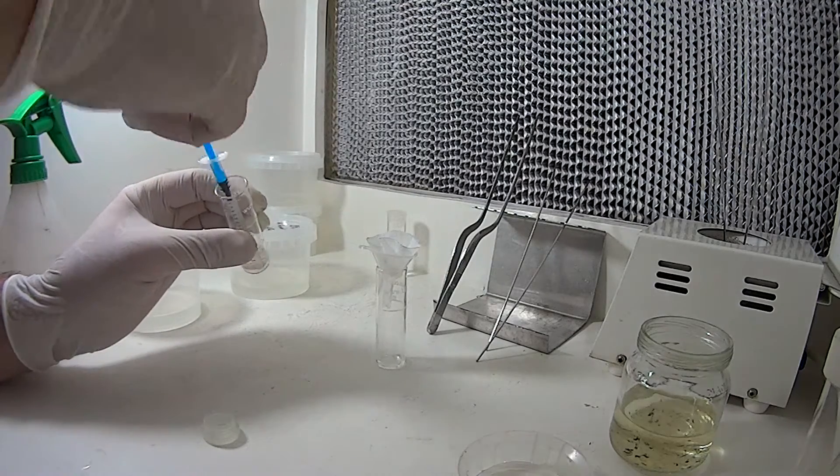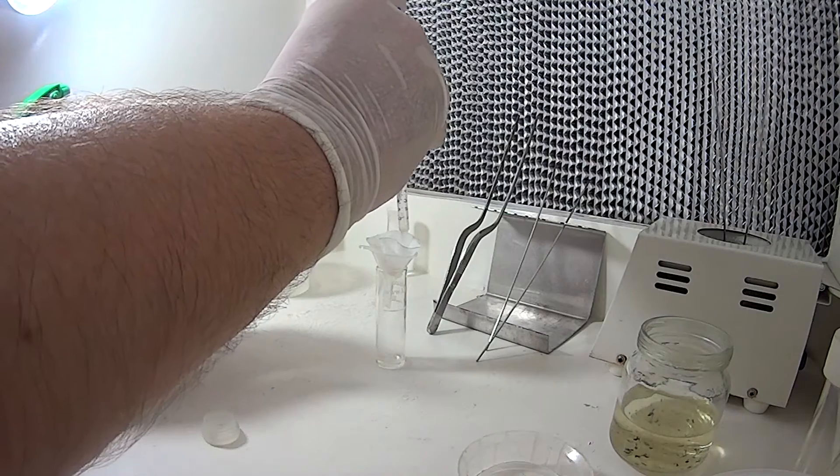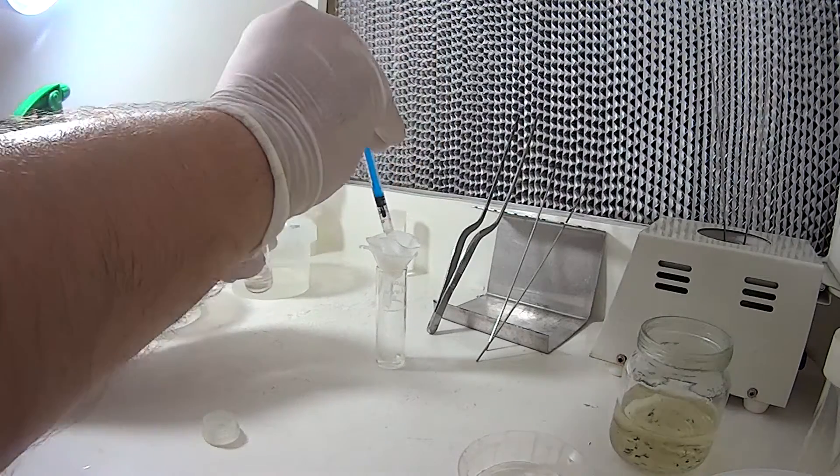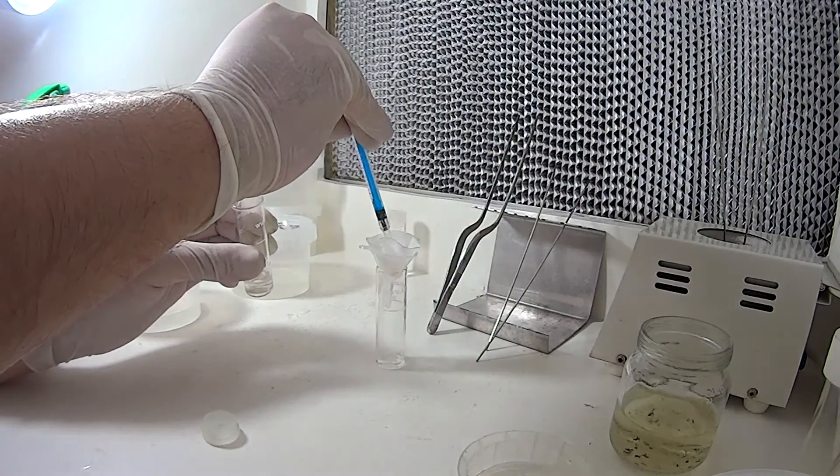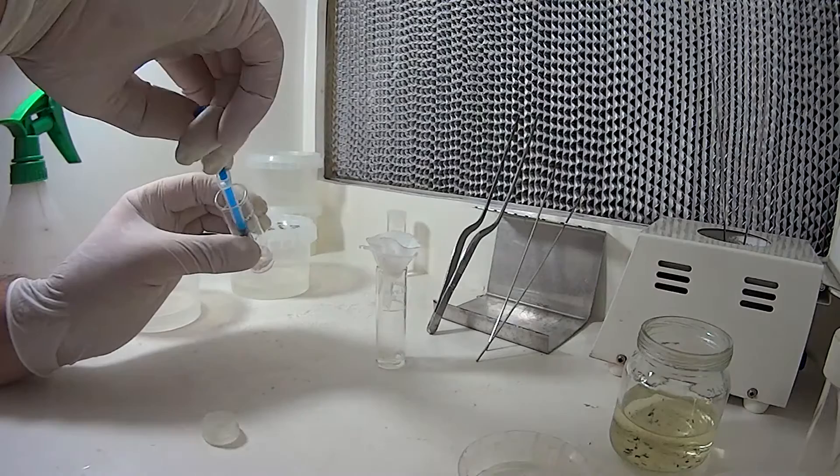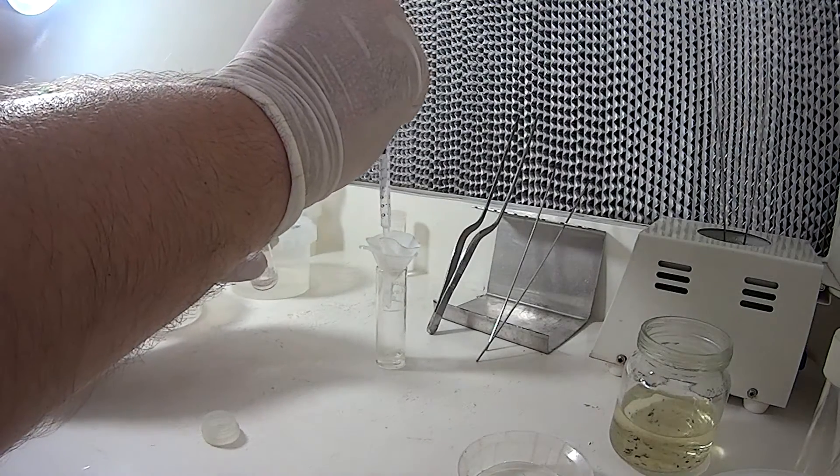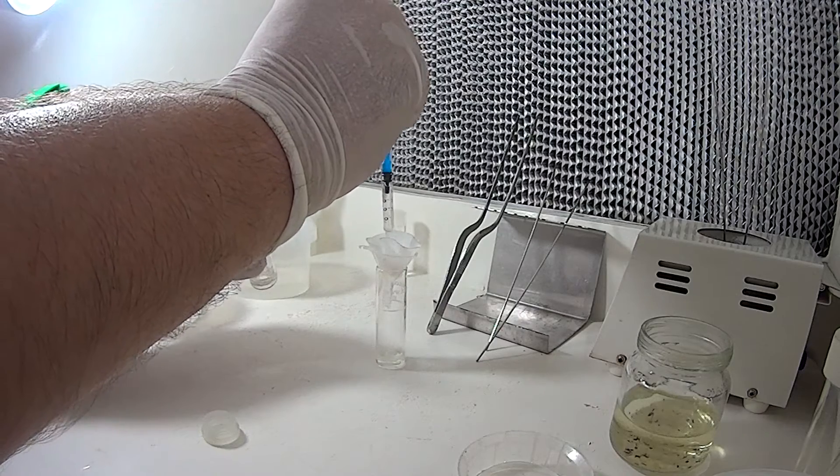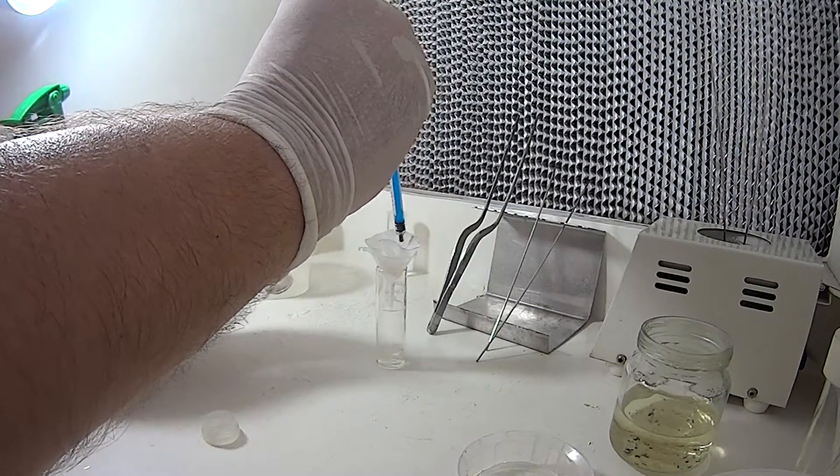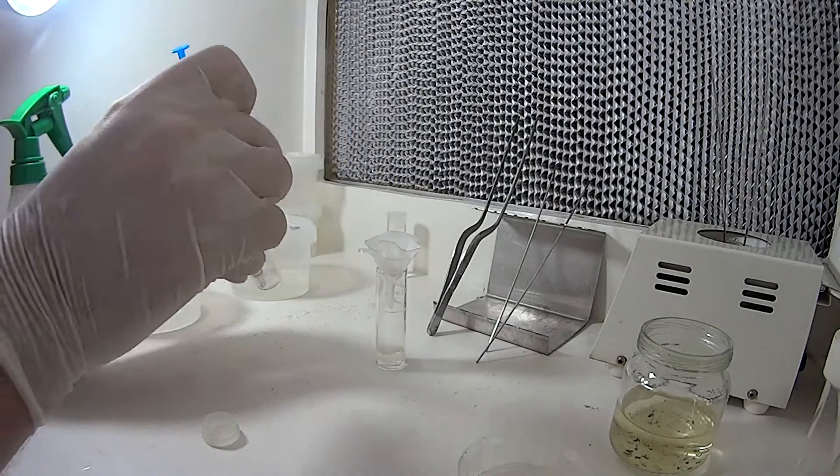Just can take a little bit of time, just do it nice and slowly, eventually get there. Once most of the seed in there, I'll rinse this container out again, as you'll see, you can't get all of that seed out the first go.